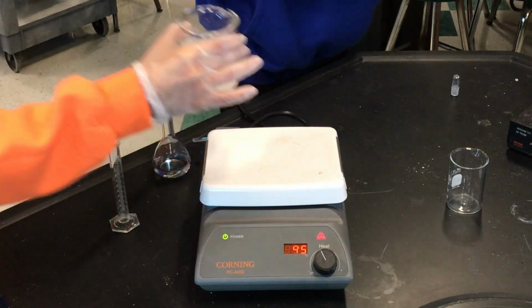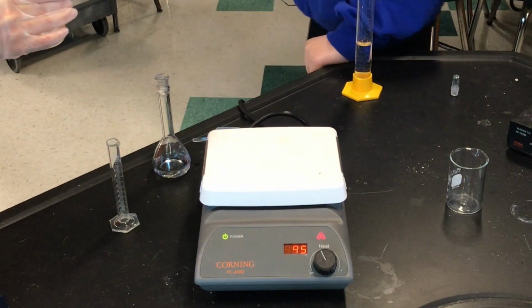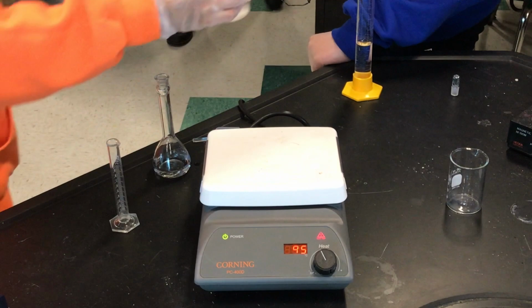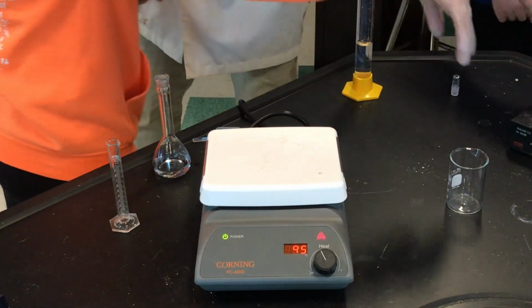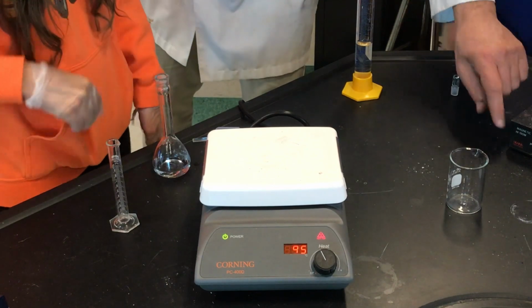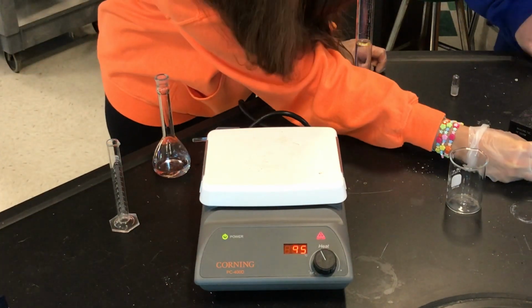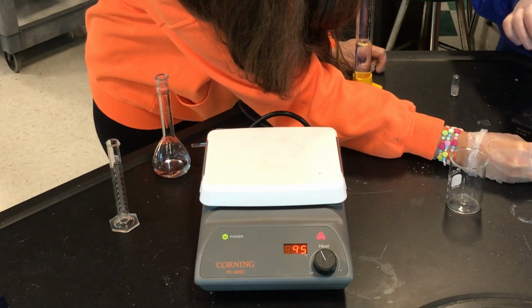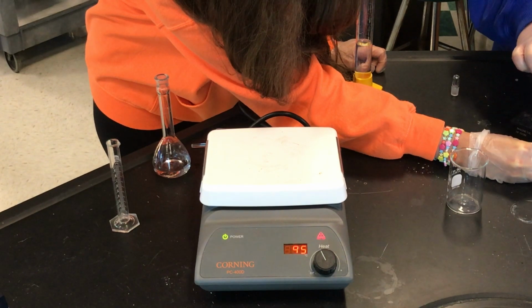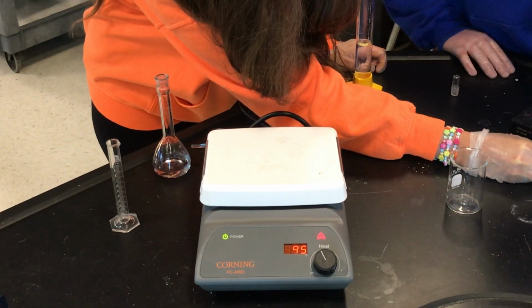Careful, it is going to be warm. We're going to throw in a magnetic stirring bar, and you're going to turn that, mix that. That's hot. Yep, and there might be some precipitates in there. Don't worry about that. Yep, let's stir it up. Get it going a little faster. A little more aggressiveness. Good.